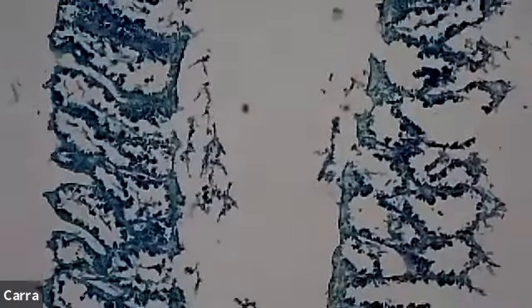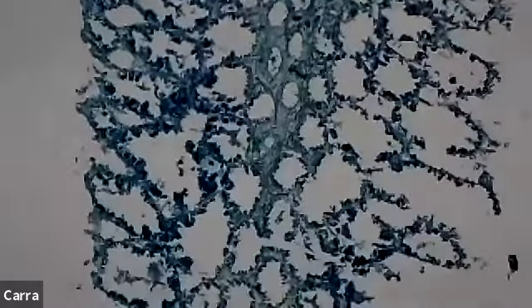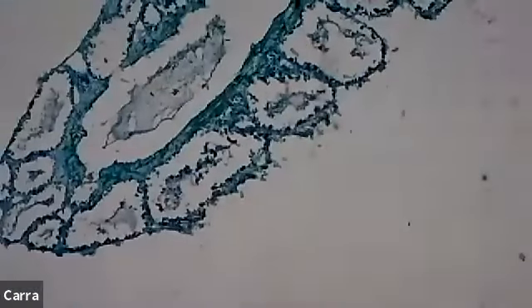But I want you to figure out, how do you remember that this is what the sponge looks like when we're looking at a longitudinal section underneath the microscope? So let's go down all the way to the bottom. I want you to have one last really good look here. Okay, so sponges.